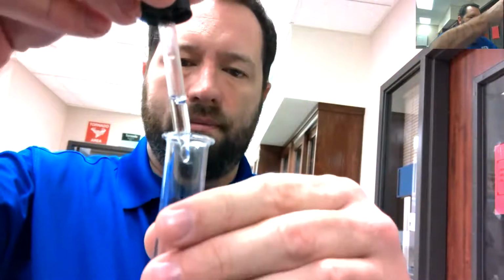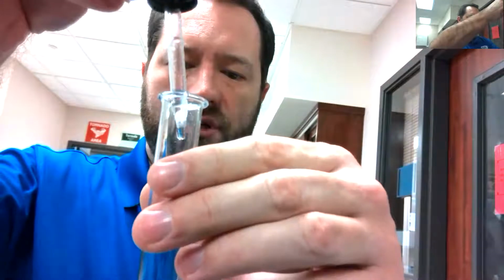Think of the Statue of Liberty, that nice, pretty blue color that copper statue has. And then we're going to add, as a catalyst, just a little bit of hydrochloric acid. Don't need much, just a couple of drops. There we go. And again, don't use hydrochloric acid as part of your reaction. It's just a catalyst. It's not actually in the reaction.